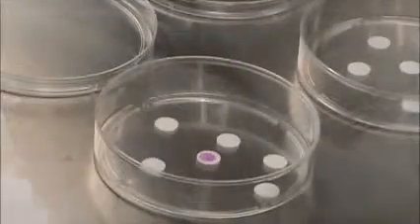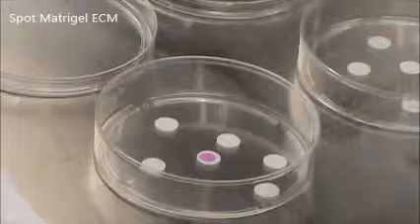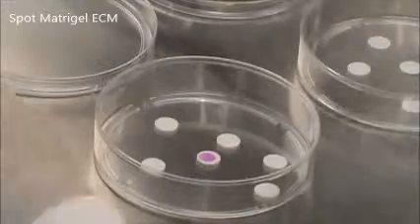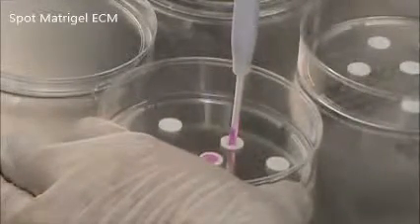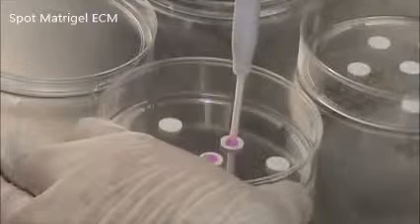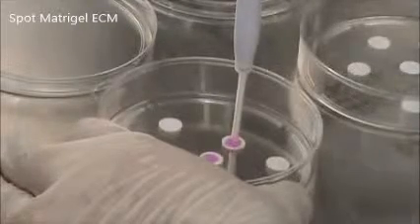With a touch of a pipette tip, simply spot uncross-linked gel. As shown here, you may even spot high protein concentration — 16 mg per milliliter — matrigel ECM.